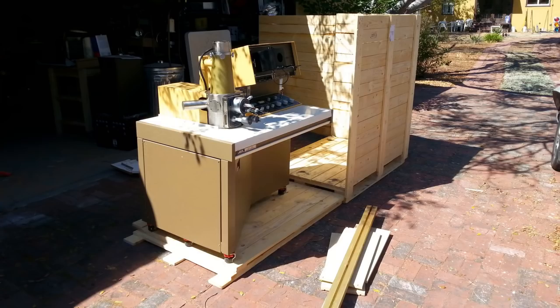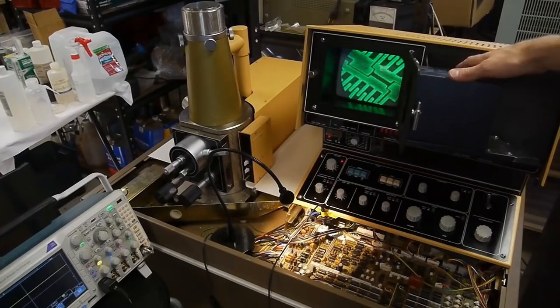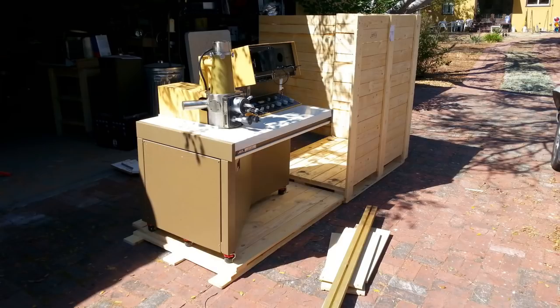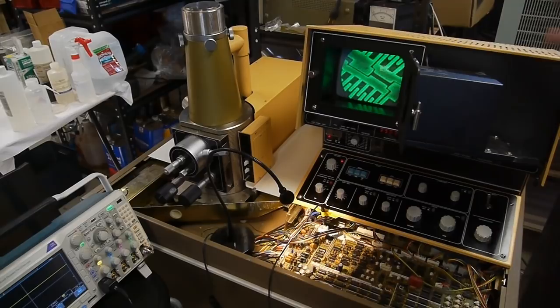Before the crate left Sweden, someone, maybe FedEx, dropped it on its back. Surprisingly the force was high enough where it actually knocked the socket connector off the back of the CRT inside here. Even more surprisingly, just replacing the connector and refilling the pump with some oil was all that it took to bring this up to fully functional status.